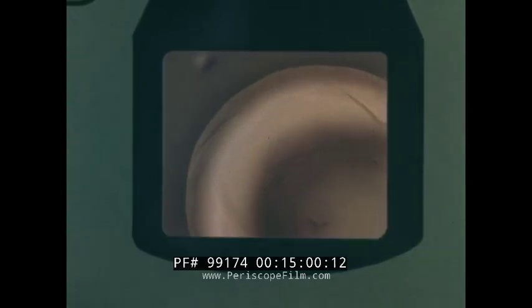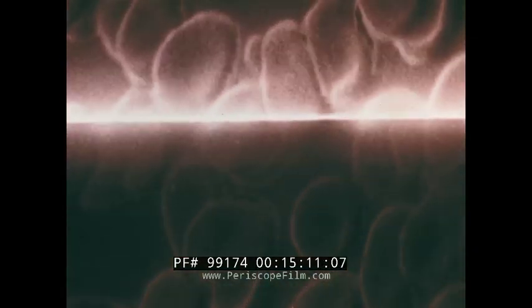In practice, the beam moves from point to point rapidly, and the series of points becomes an image of a line across the specimen. The specimen is scanned by the electron beam so that these lines follow one another rapidly. Any portion of the specimen scanned by the beam will be visualized on the cathode ray tube. The scanning electron microscope can magnify up to 20,000 times.